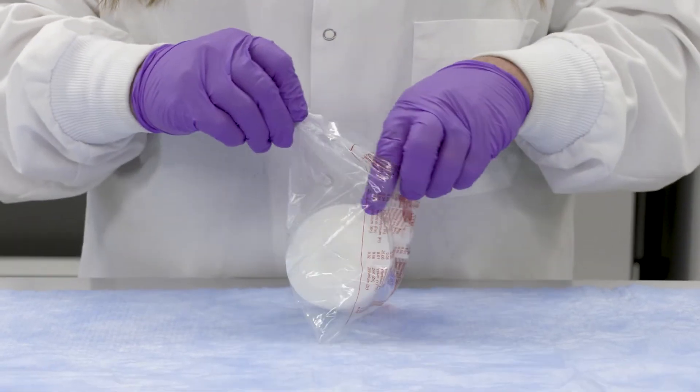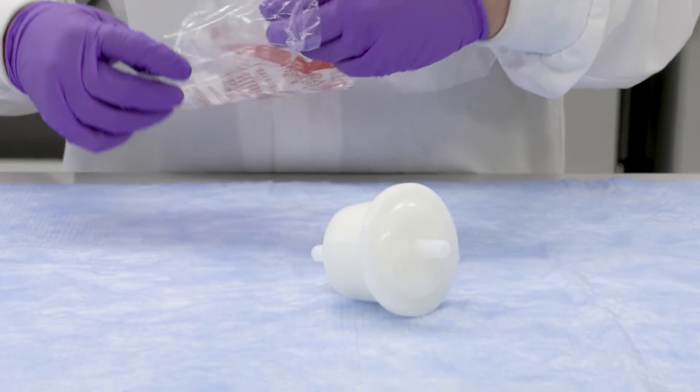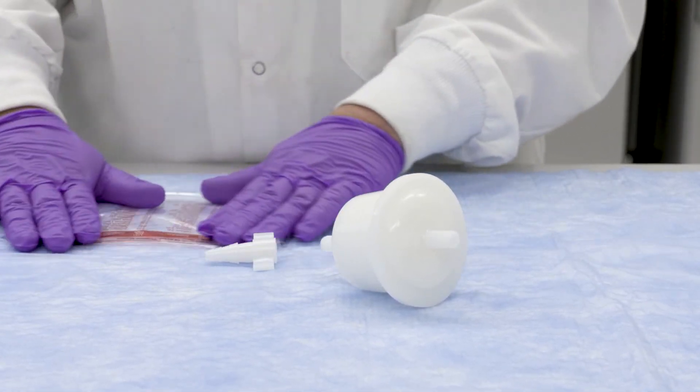Open the package. Make note of flow direction and if needed attach the stepped hose adapter to the end of the pump's 3/8 inch ID tubing line.